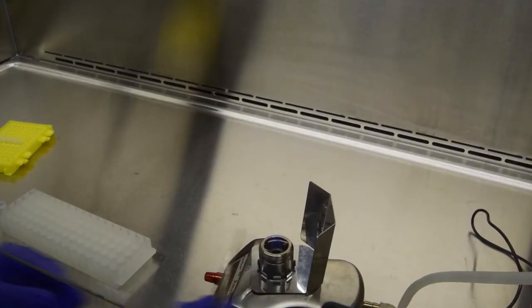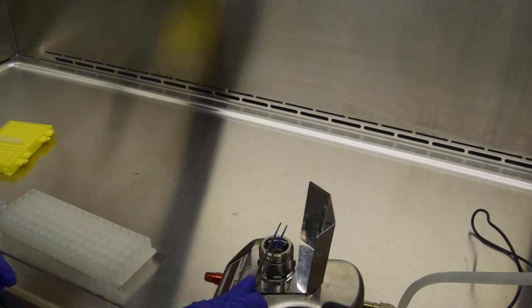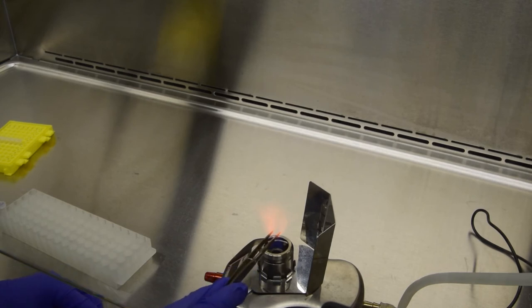In a 12-well plate, with each well containing 2 ml of induction media, recipe in notes, add 3-5 sterilized glass beads measuring 3 mm in diameter using sterilized forceps. The beads will help spread cells first, then help resuspend later.